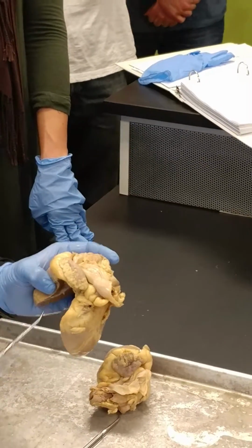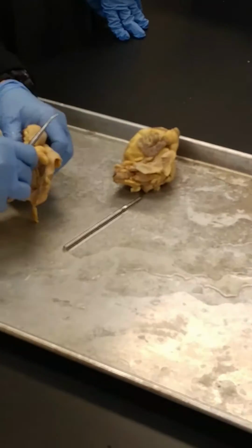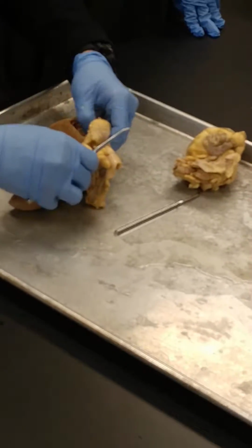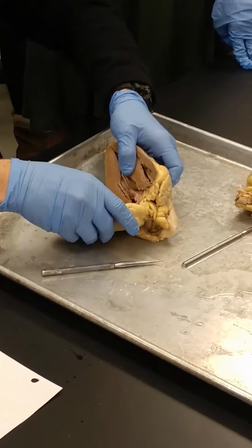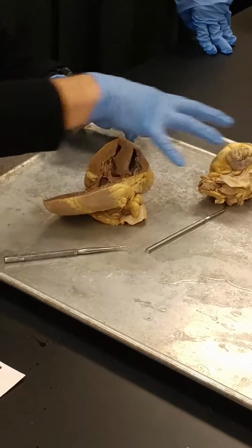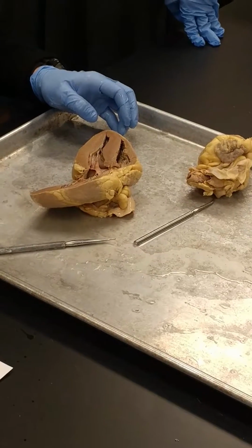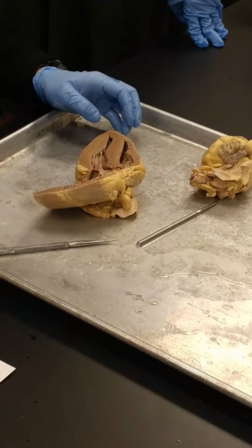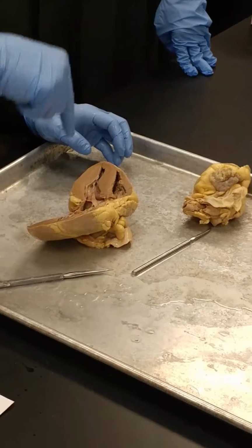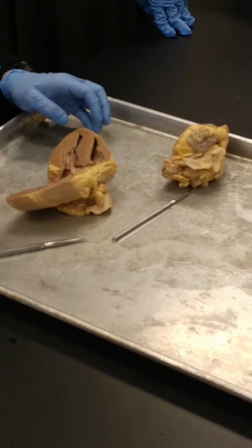All right? So on the test, how would you ask us for the coronary sinus? Would you have that probe in there? We'd probably put a probe in there. It's kind of tough to do because what we don't want is everybody messing with this stuff, right? But if you look at a schematic of these, what you'll see when you look in the right atrium, you'll see a big upper hole, a big lower hole. That's the inferior vena cava where it enters. And then a little hole going kind of in between the two going off to the side. Okay. That would be your coronary sinus.